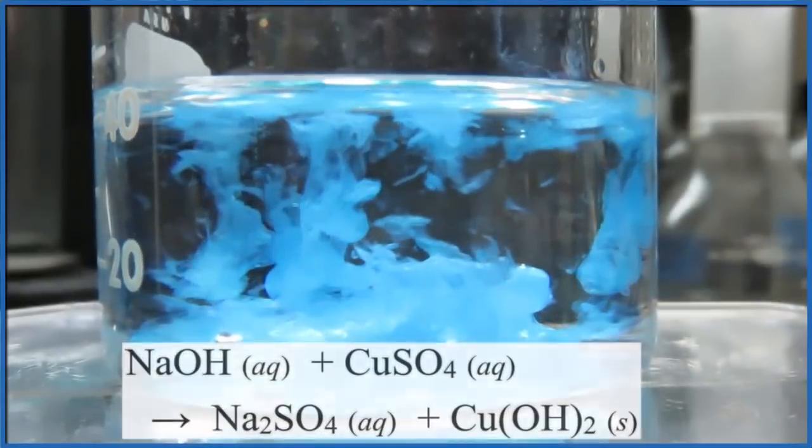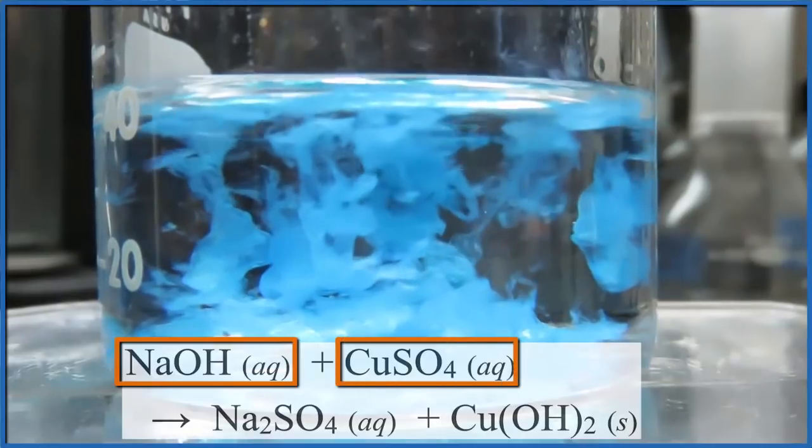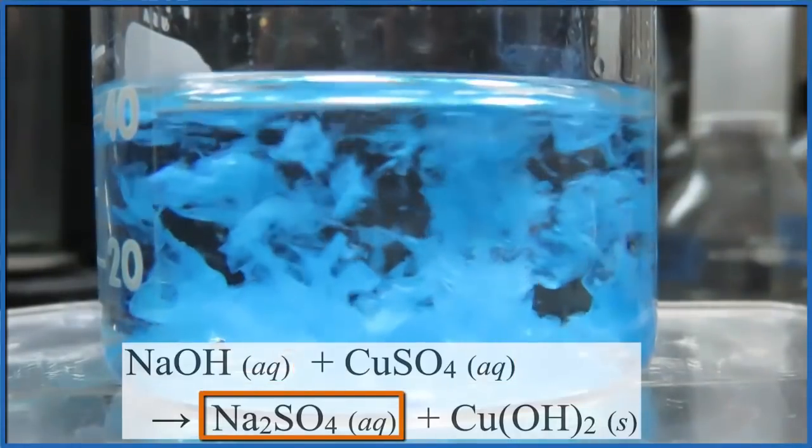So here's the reaction: the aqueous sodium hydroxide and the aqueous copper sulfate mix together, they form Na2SO4, that's aqueous, it stays dissolved.